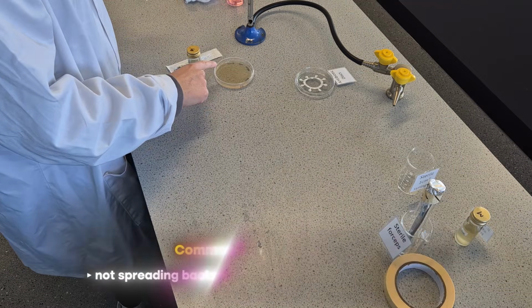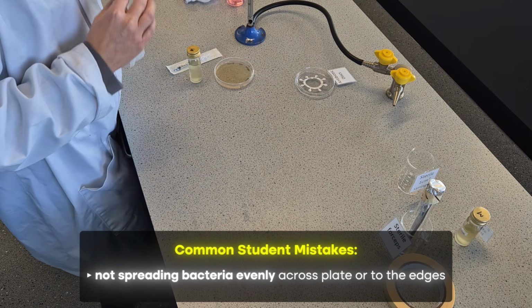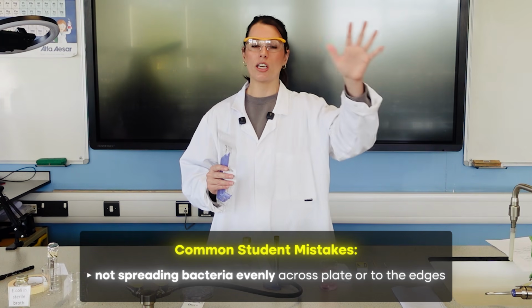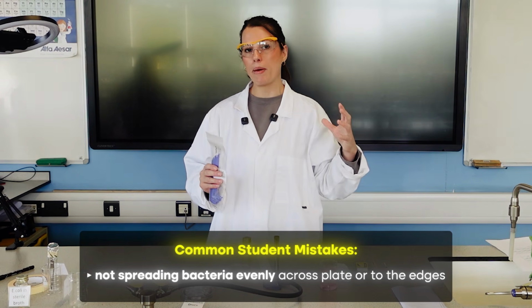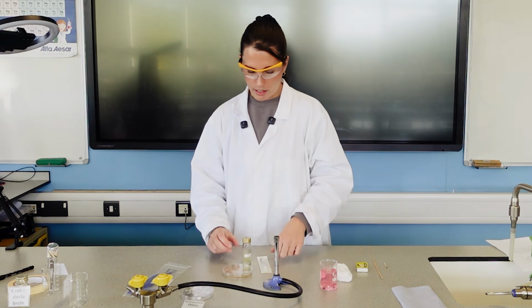Another key mistake that we'll see, and I'll point this out as I go through it, is when using the spreader, sometimes students don't actually spread all the way across their plate to the edges. So you then don't get the complete bacterial lawn covering the whole dish, and that can impact the ability of you being able to see the inhibition zones. So let's have a look at this.